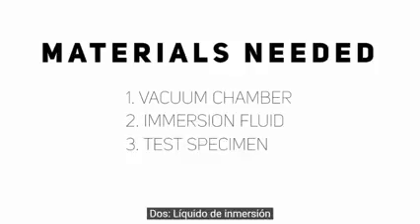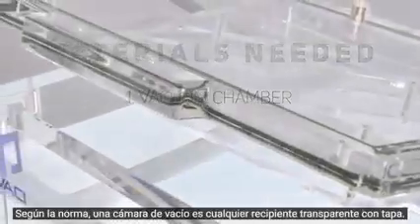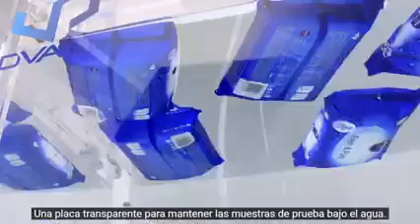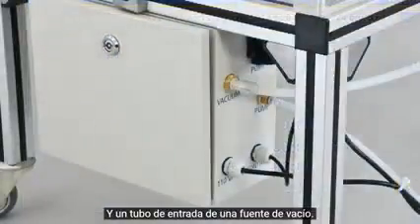To begin, we need the following elements. 1. A vacuum chamber. 2. Immersion fluid. And 3. Test specimen or sample. According to the norm, a vacuum chamber is any transparent container with a lid, a transparent plate to keep the test samples underwater, a vacuum gauge, and an inlet tube from a source of vacuum.